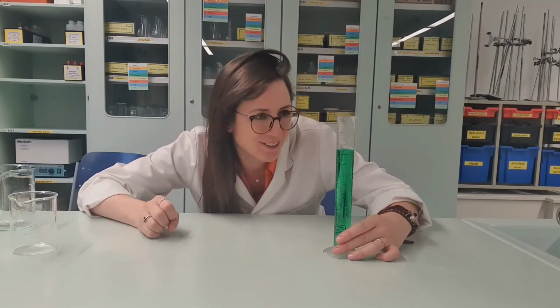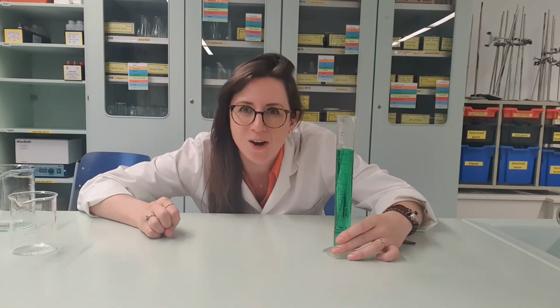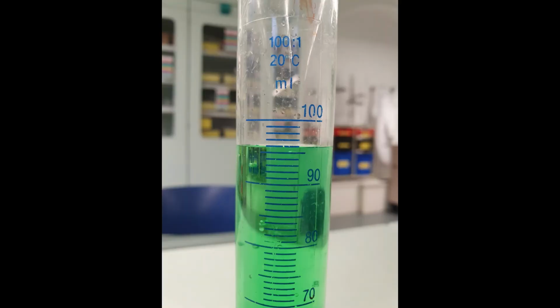Okay, so I would say that was pretty much 96 milliliters. 4 milliliters out. Take a look for yourself. So according to the measuring cylinder, I actually measured out 96 milliliters, not 100. The moral of the story is, never use a beaker to precisely measure out volumes of liquid.